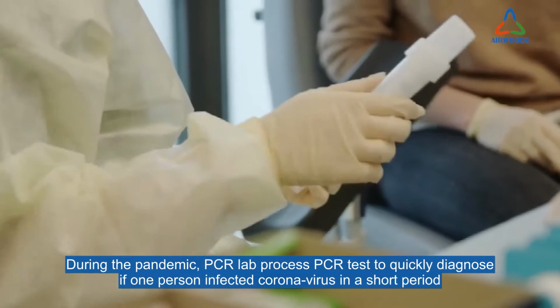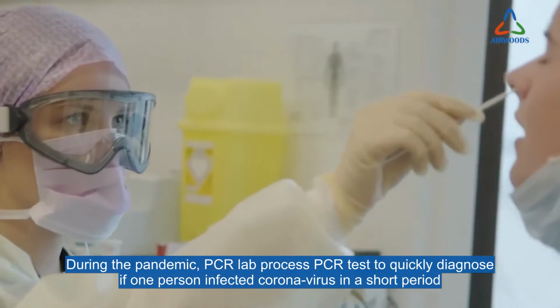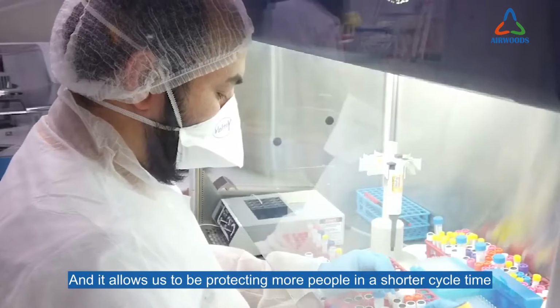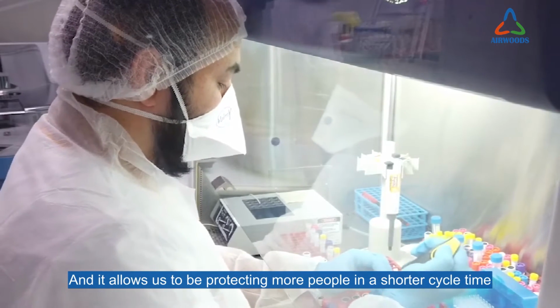During the pandemic, PCR labs processed PCR tests to quickly diagnose whether a person was infected with coronavirus in a short period, and allowed us to protect more people in a shorter cycle time.